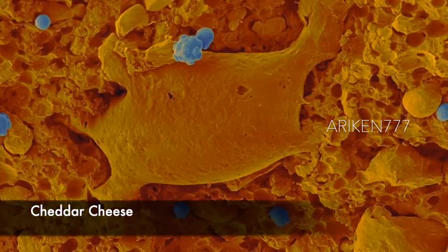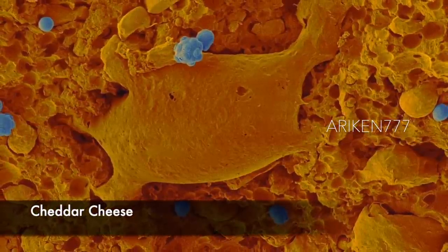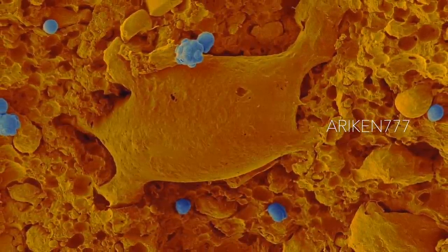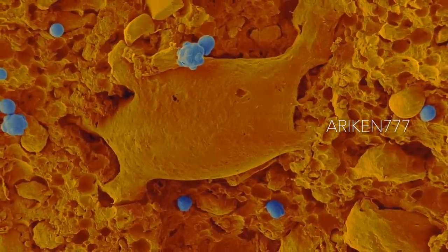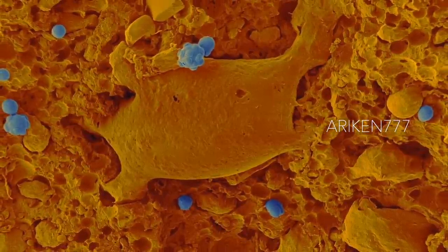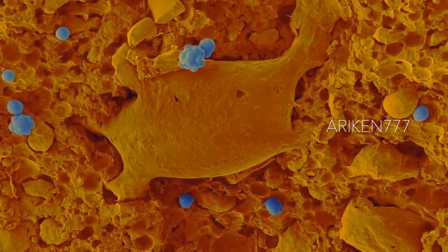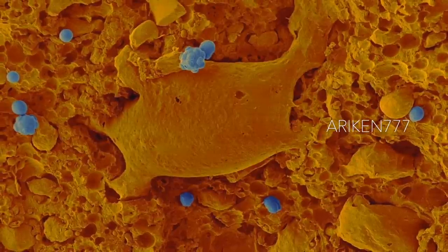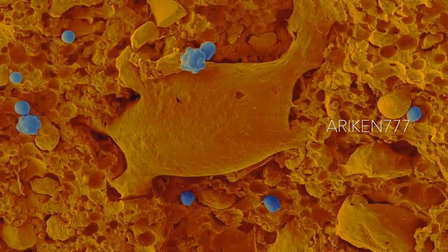Fractured surface of a piece of cheddar cheese. Also seen are small yeast cells contaminating this piece of cheese. Cheddar cheese is a hard cheese prepared from cow's milk by a process called cheddaring, a method originally from Cheddar in Somerset, England.